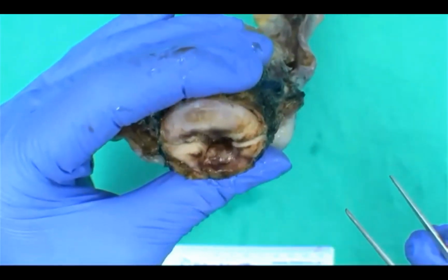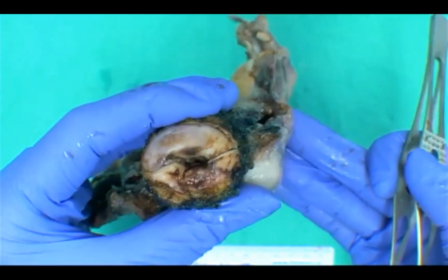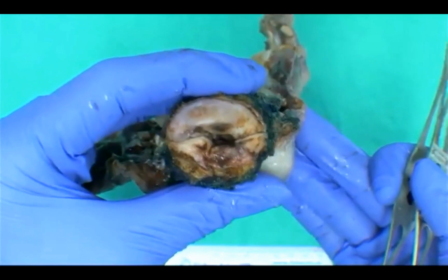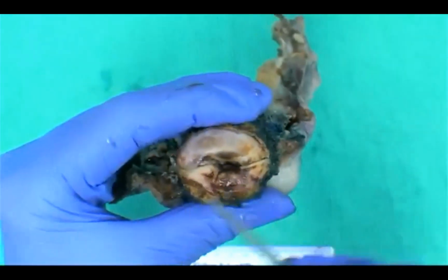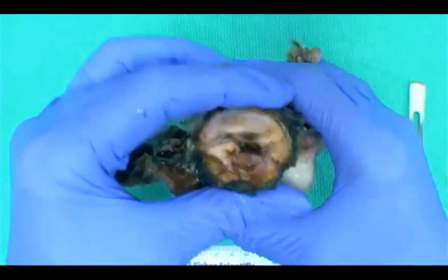What could congestion on the cervix be from? Great, yeah, prior definitely an option. So anything that would disrupt this area could be previous biopsy or a LEEP. So that's always a good thing to keep in mind.